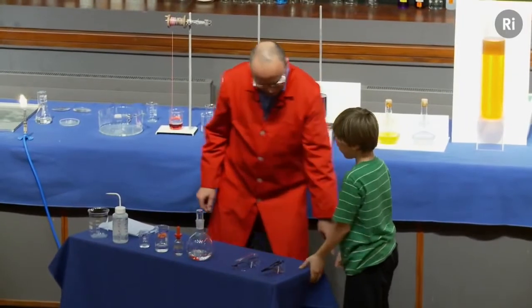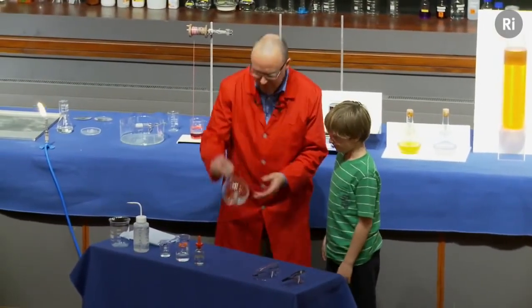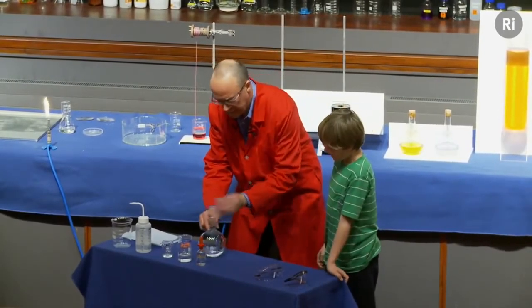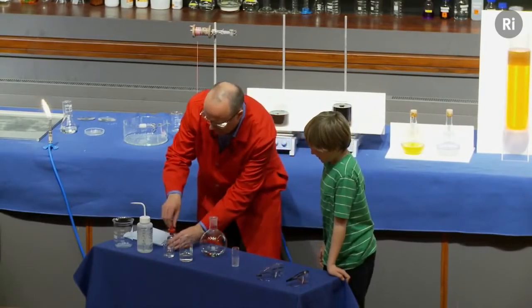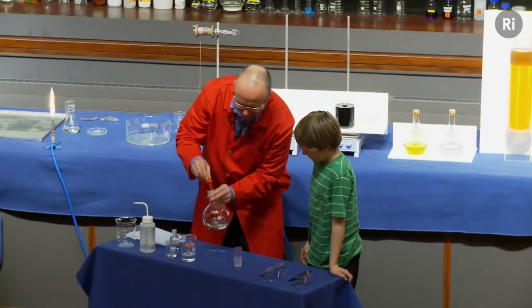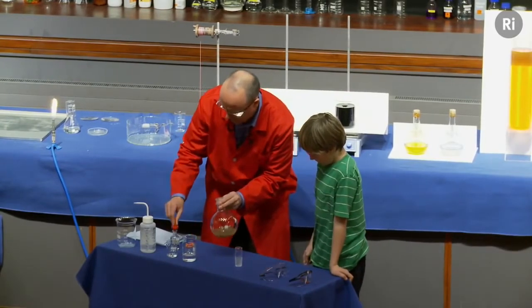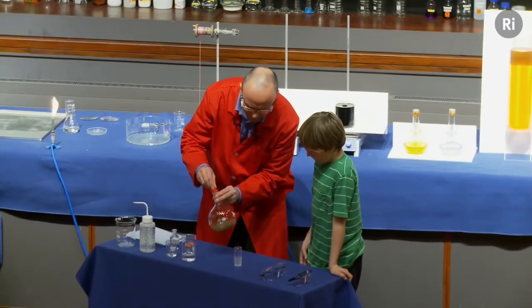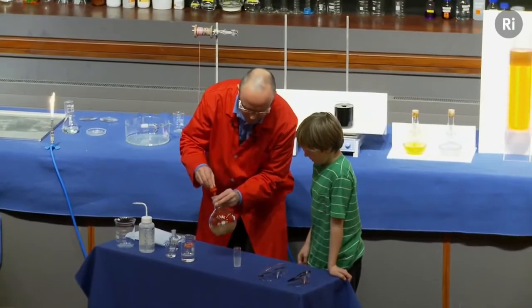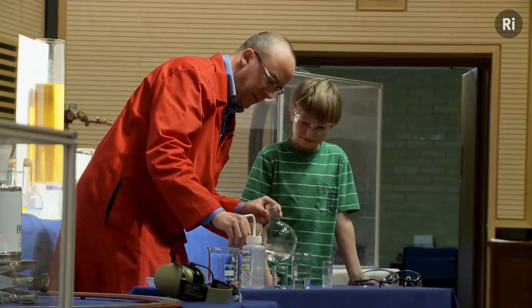Dylan. All right, Dylan, if you stand just there, we're going to do some chemistry and we're going to make a solid. All right, I'm going to start off with a flask that contains a solution of silver nitrate, and I'm going to add a little bit of ammonia. Now when I add the ammonia, you see that it's forming a sort of brown colour. I'm going to keep on adding the ammonia, and in a minute that brown colour should disappear. There we are, it's disappeared, isn't it?